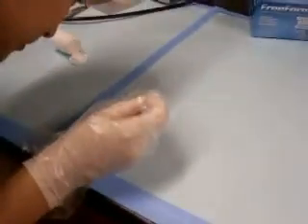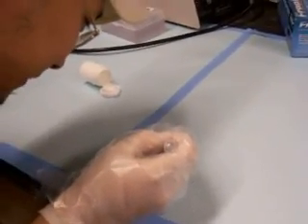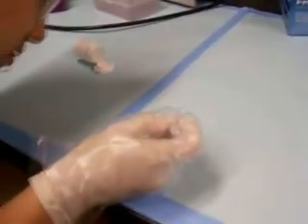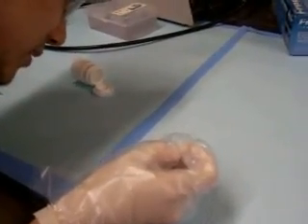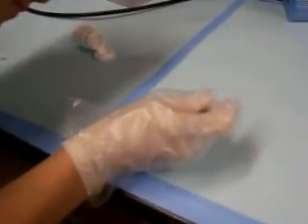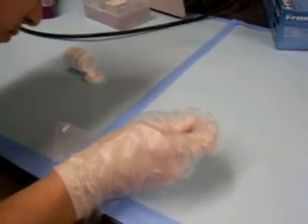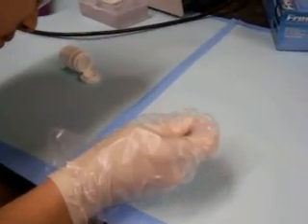Okay. Step 1, sucking up visible mercury with that thing. This could potentially cause more problems than it's good at. Is that definitely liquid as you manipulate it? It's unclear what phase this material is. There appears to be a second type of material here that may be evidence of the type of perpetrator we might be dealing with. We have to mention that while there's a safety aspect to this procedure here, there's also a criminal investigation which we have launched, of which I am the lead authority. We will determine, potentially, who caused this malicious accident and soiling of a common laboratory space.